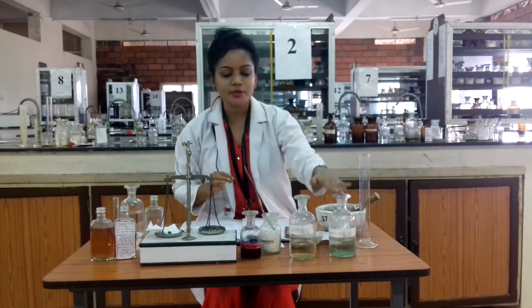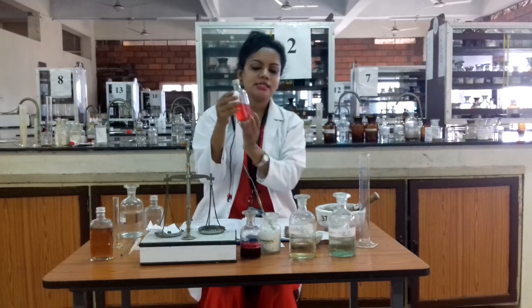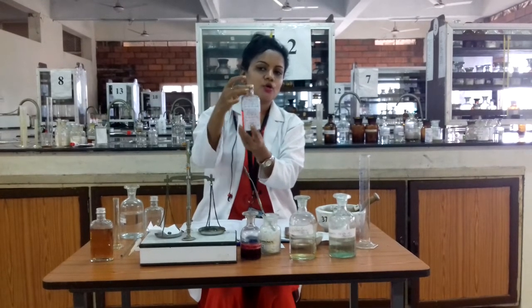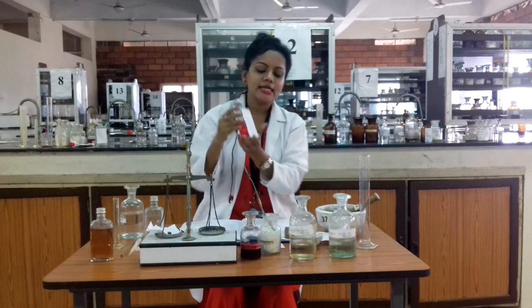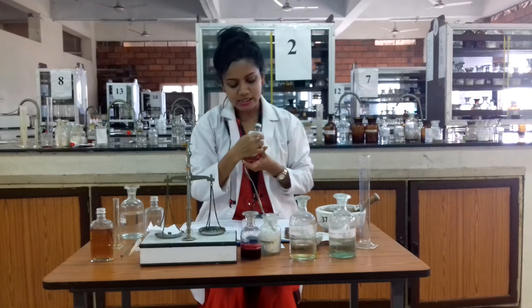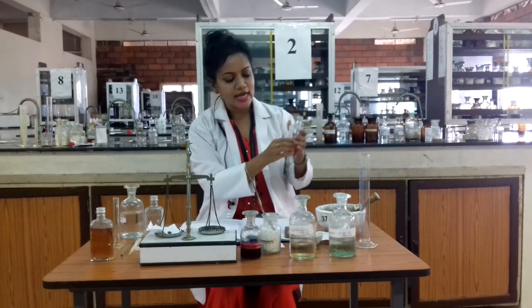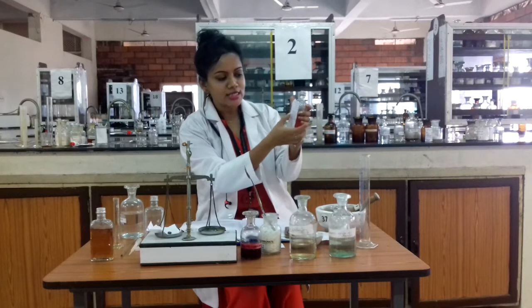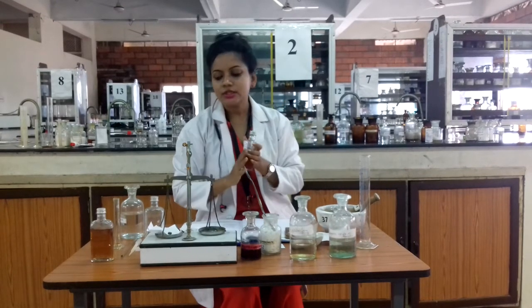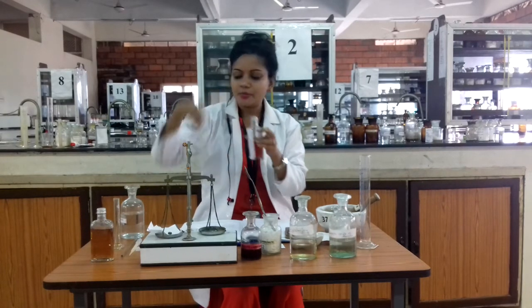Then add all other liquid ingredients, and finally we get the carminative mixture. This is the colour of the mixture. Dispense in a narrow mouth bottle and label suitably. The quantity indicated is 60 ml. Shake well before use. Write the patient's details, and the direction for use is: one large division solution to be taken twice daily after food.